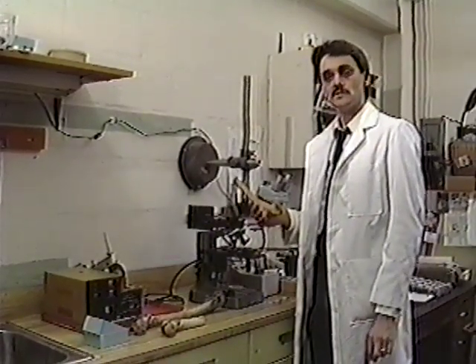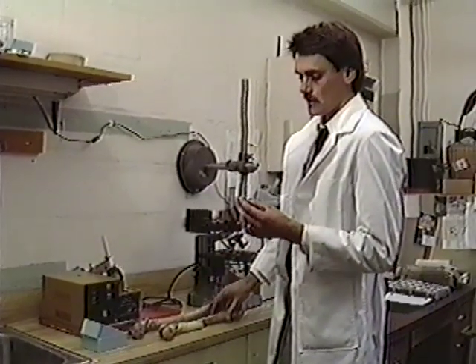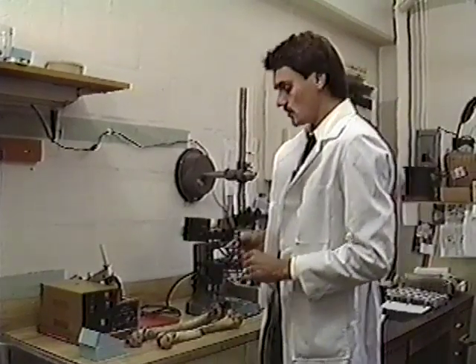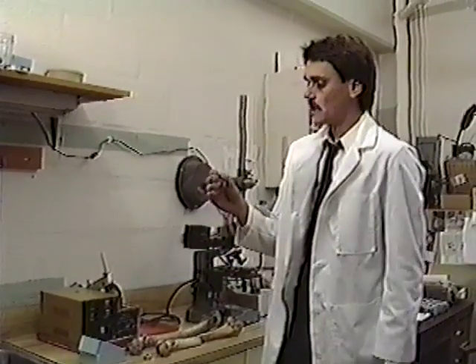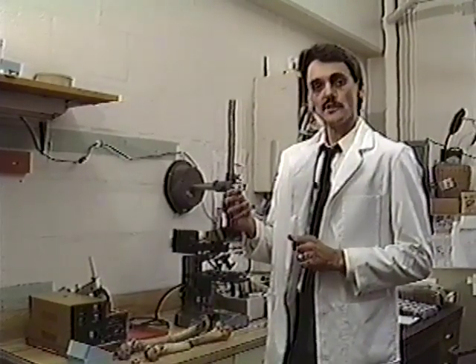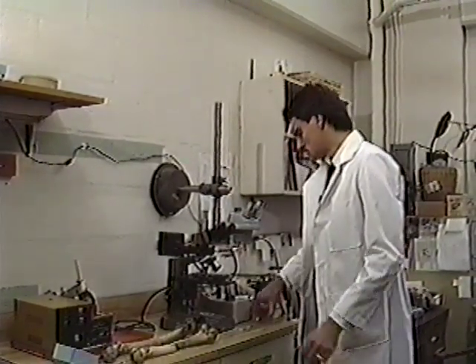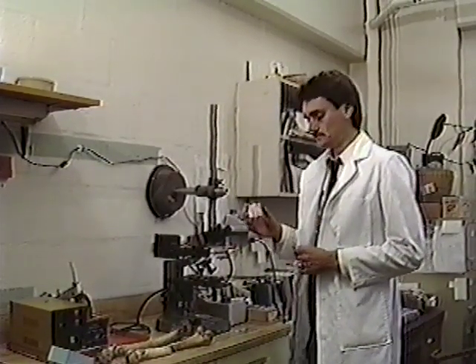He also utilized a tibia or a fibula, in which you take a section from this bone, and in this case, I mount it on a diamond-embedded blade on a slow-speed saw. We make an initial cut, and this cut produces a slice of bone that is about 200 microns thick. From this point, I take the specimen and I grind it down to about 80 microns. I polish it, and then it is ready to mount microscopically on a slide, and it now is available for viewing under the microscope.